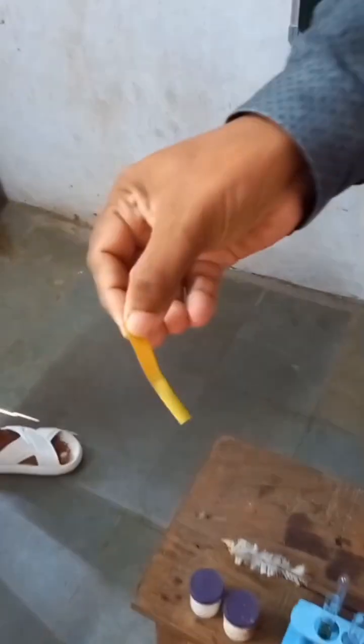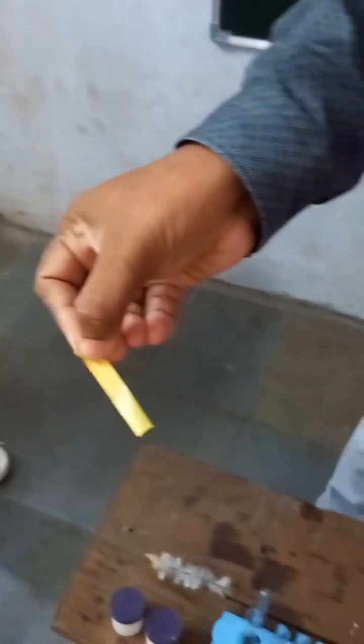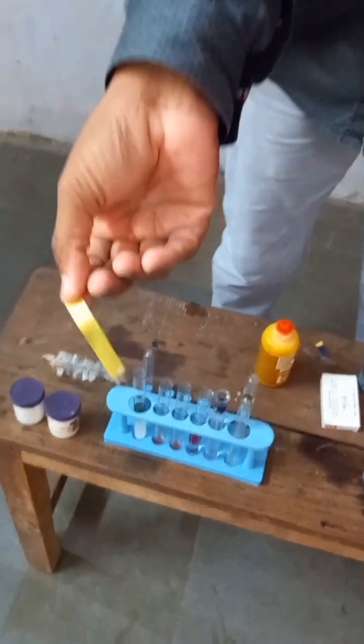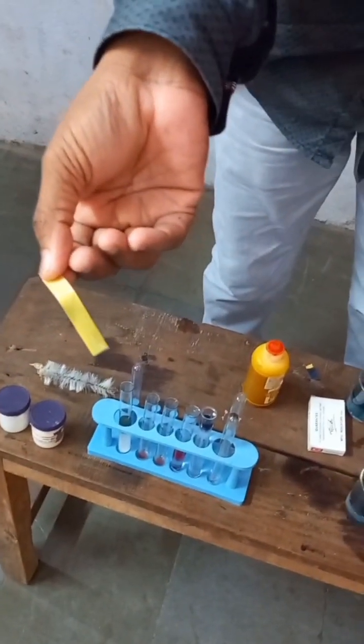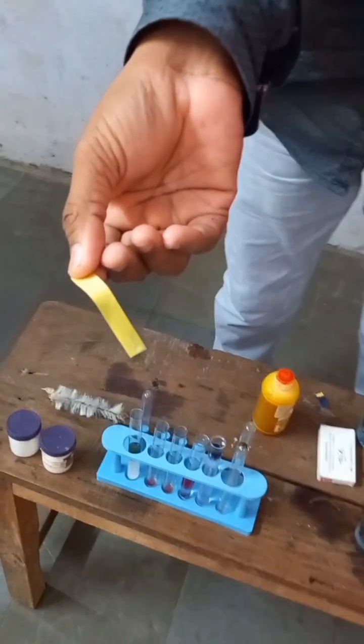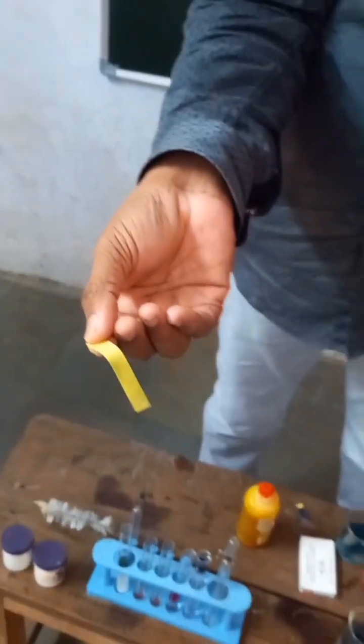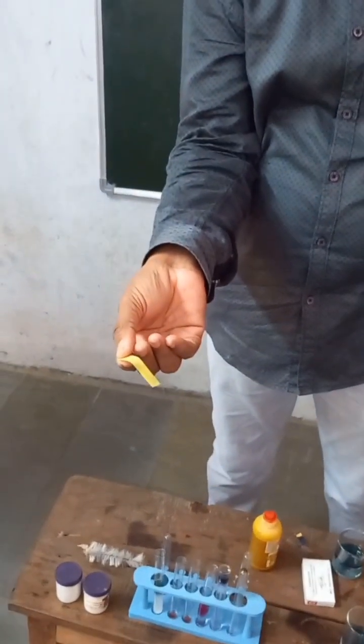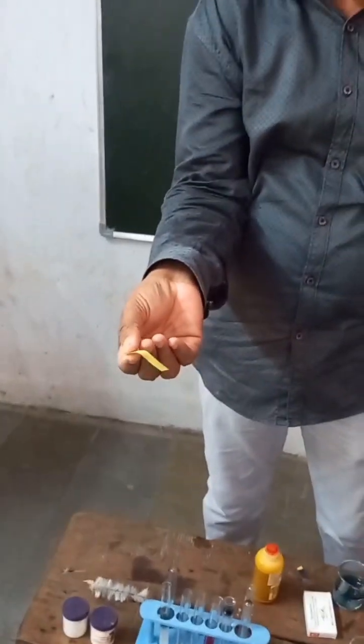What is this color? Green — is it green? This is from saliva. Green color means its pH is nearly neutral.